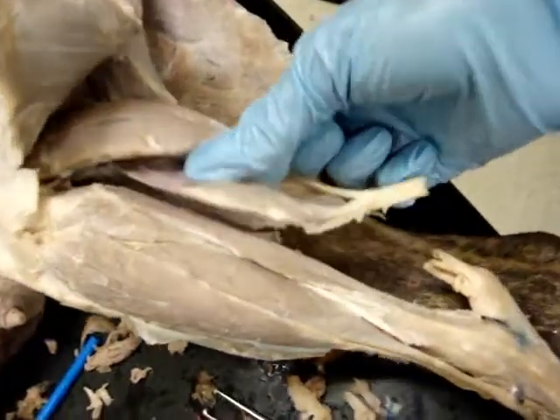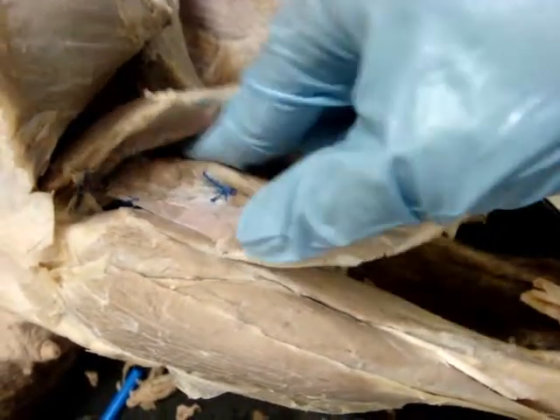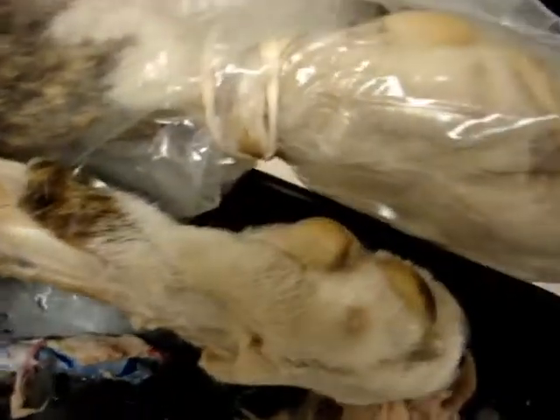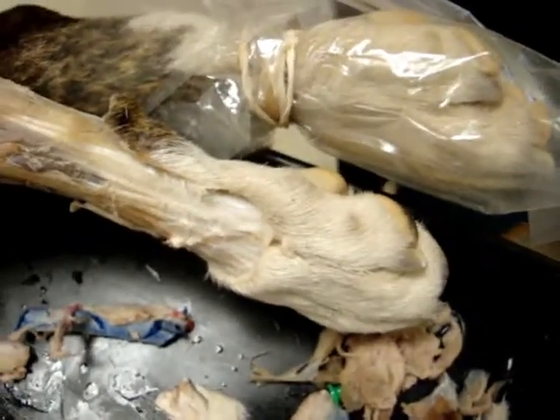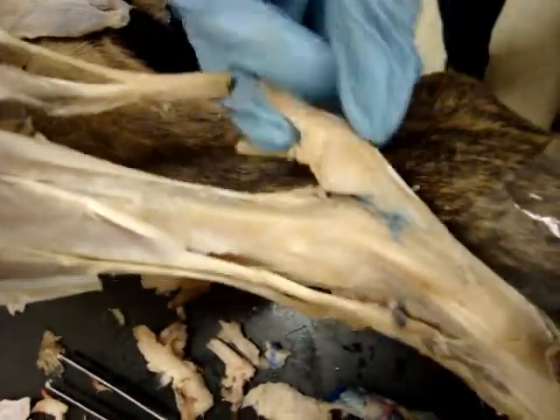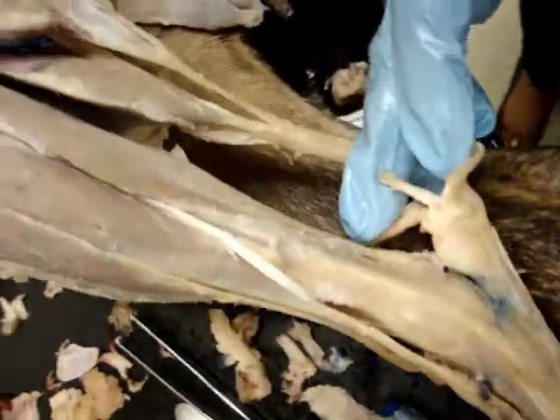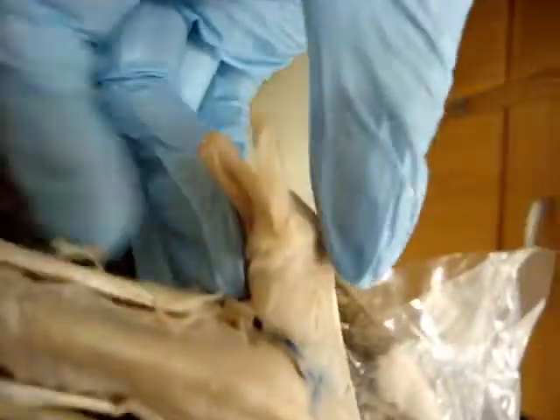The superficial digital flexor is a spindle-shaped muscle that originates from the lateral supracondylar tuberosity of the femur and inserts into the tuber calcaneae and the base of the middle phalanges of digits 2, 3, 4, and 5. Its action is to flex the first two digital joints of the four principal digits, flex the stifle, and extend the tarsus. It is innervated by the tibial nerve. A sagittal incision through the superficial digital flexor tendon would reveal the large calcaneal bursa, though the fluid has been lost in this specimen.